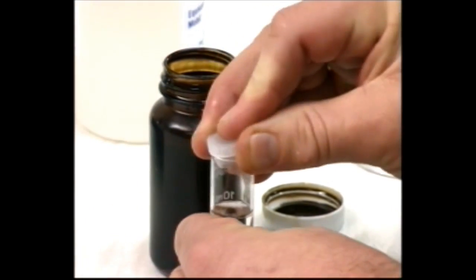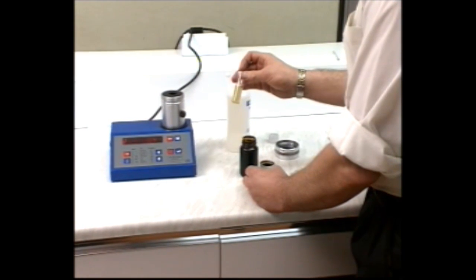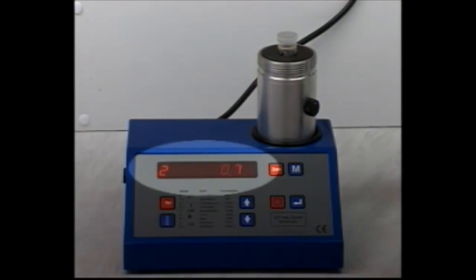Put the cap on the tube, shake well, and let any bubbles settle. Insert the tube fully into the cell and record the reading once it has stabilized.